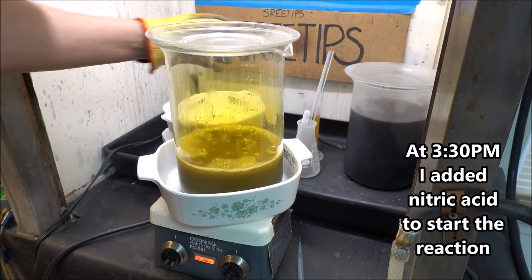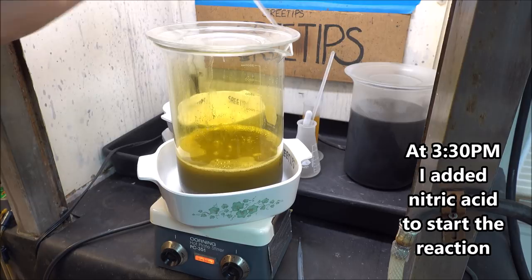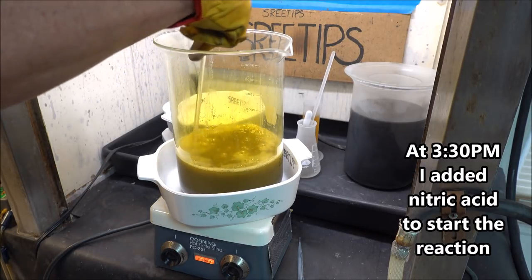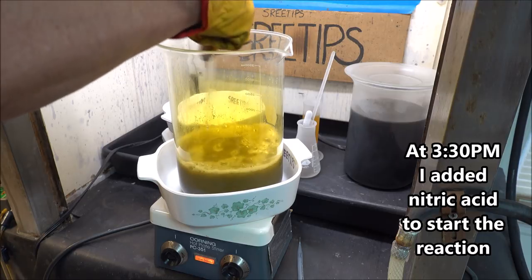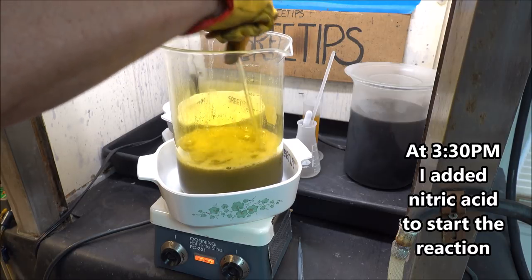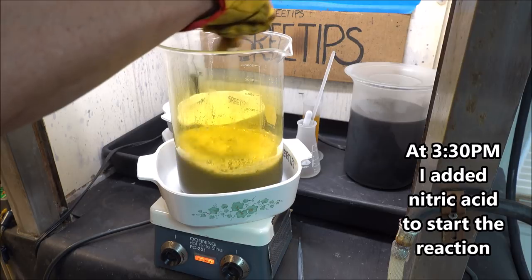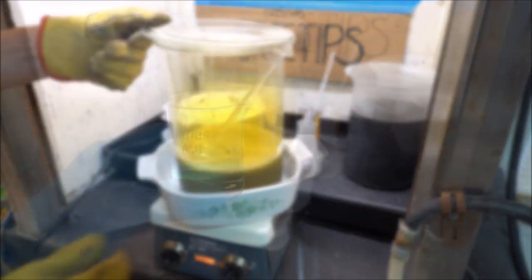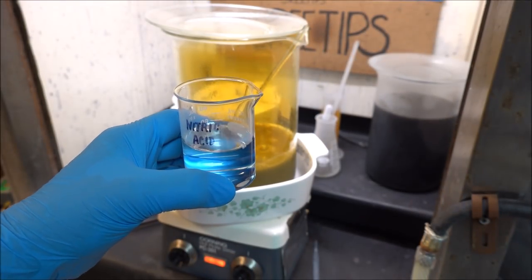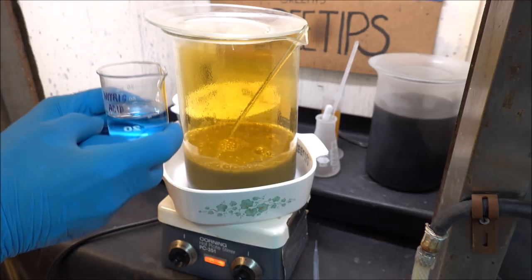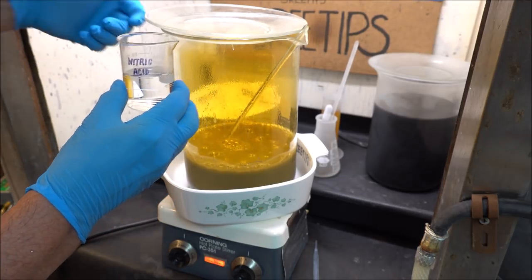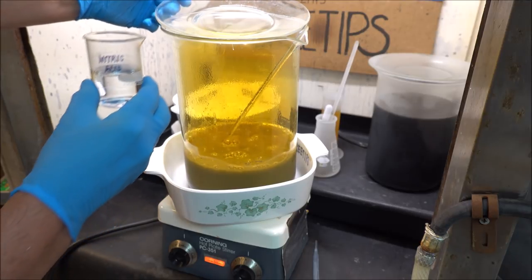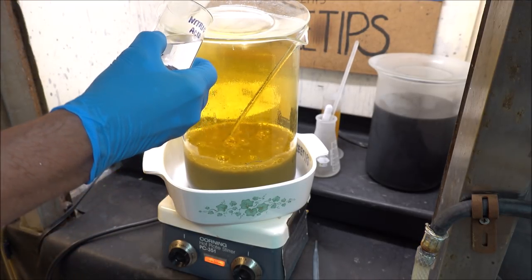It's been about 20 minutes since I added the nitric acid. I'll reach in here and give this a little bit of a stir. I've got about just under 60 milliliters concentrated nitric acid here. This has been boiling for an hour now. I'm going to slowly add this additional nitric.